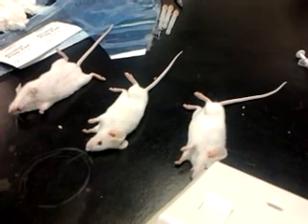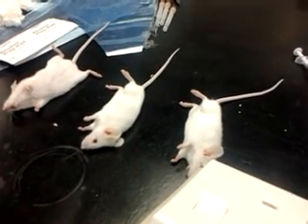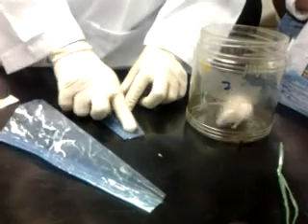Now when we do IV, we need a stool to sit down at the table. Okay, we need to be very stable. Can you give me a stool? 21.7. Very squishy, eh? So look at this one. At least I can escape now.